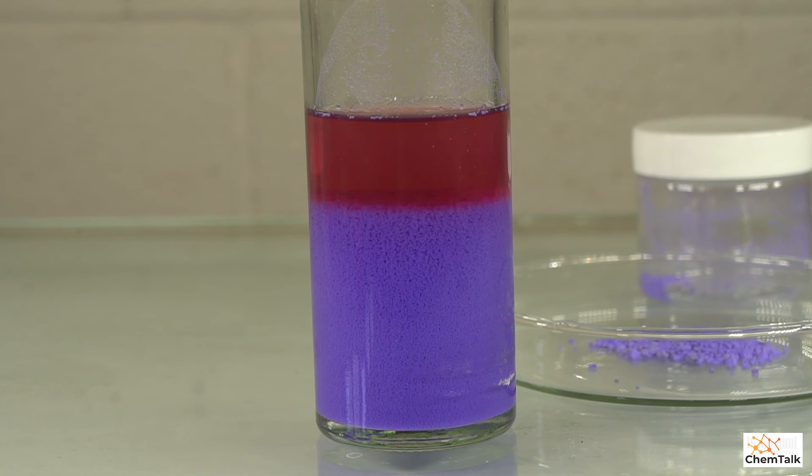So this is why doing transition metal chemistry is so great. We're going to filter this later. We're going to add this to our element collection and students, teachers, scientists, everyone will really enjoy seeing some beautiful chemistry like this.